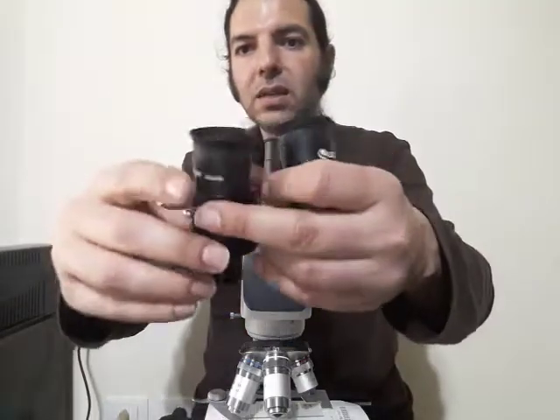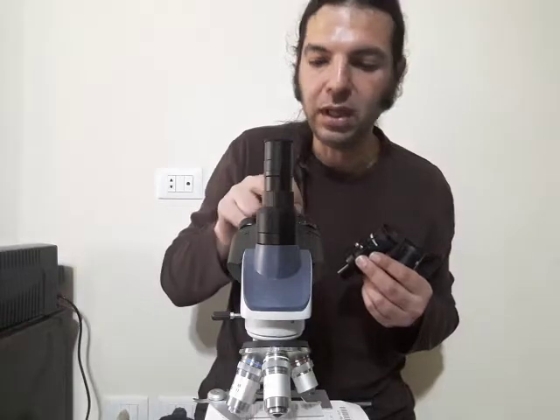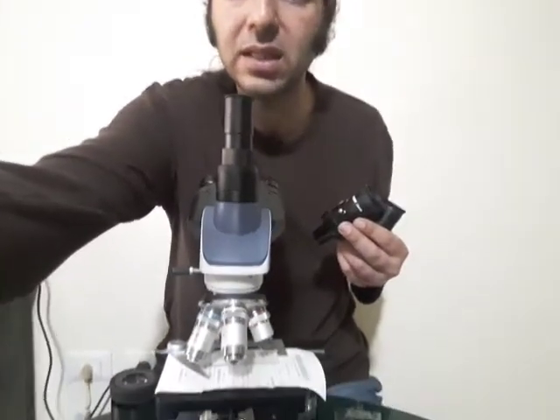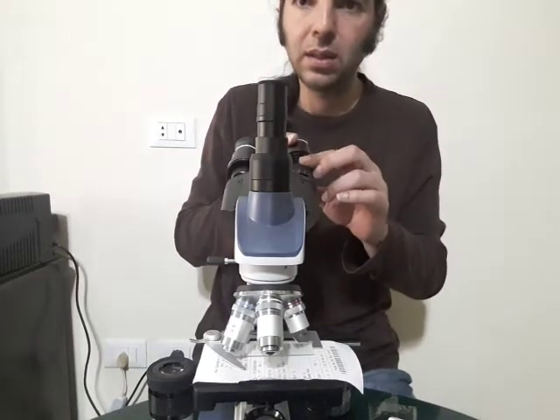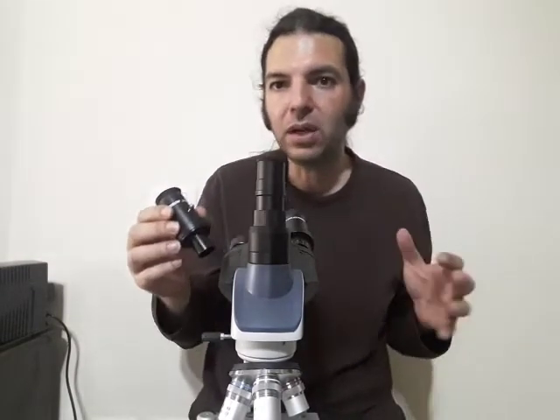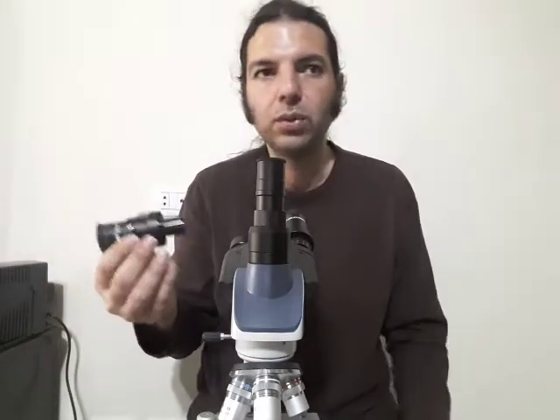Now we have two assembled like this, and I'll give you a view and my feedback on what's going on with the microscope. I don't have biological samples, but I have something that lots of light passes through — a receipt from my nearby supermarket. Now, one very important thing: if it doesn't focus, you need a Barlow lens. You have to install a Barlow because Barlows extend the effective focal length, which helps you focus when you otherwise cannot.